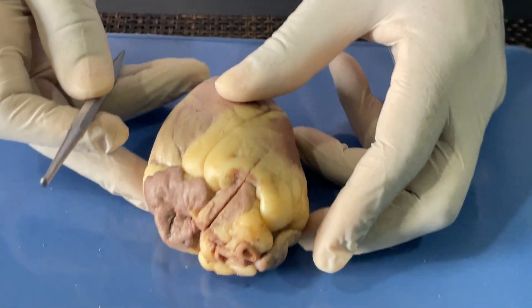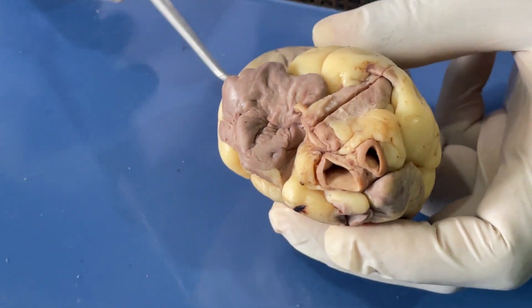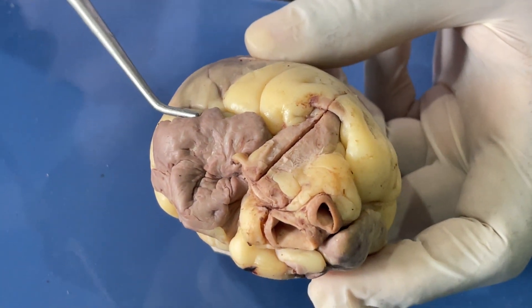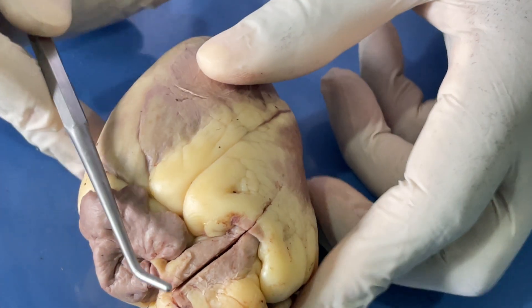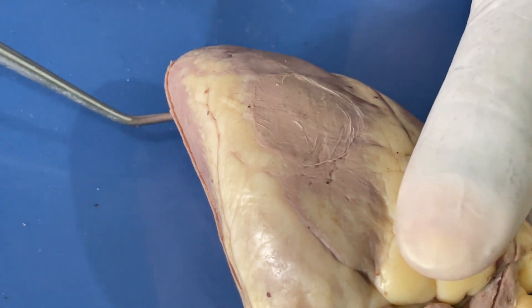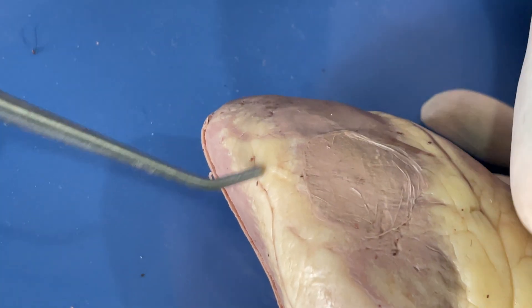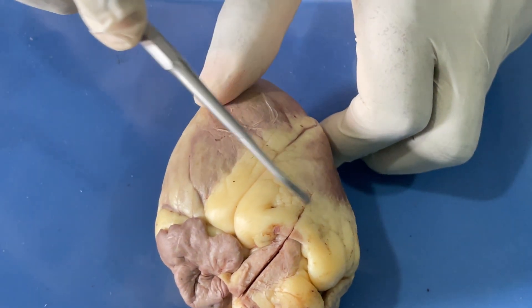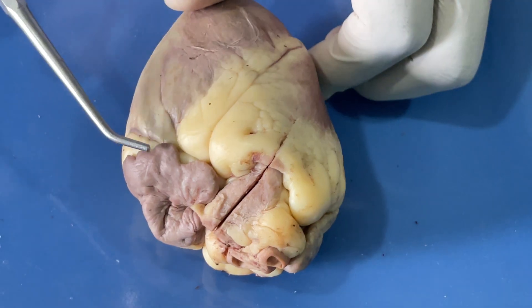When you look at the heart, we have the left auricle and then we have the right auricle. The auricles are ear-like flaps which are made up of muscle from the heart. Then we have the apex of the heart here, which is made up of the muscle from the left ventricle. You can also observe the base of the heart, which is made up of the attachment of the great vessels that enter and exit the heart.